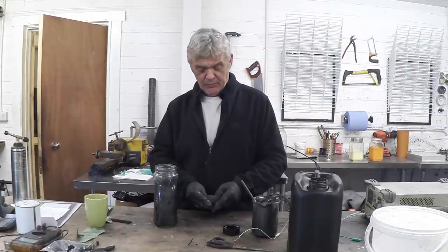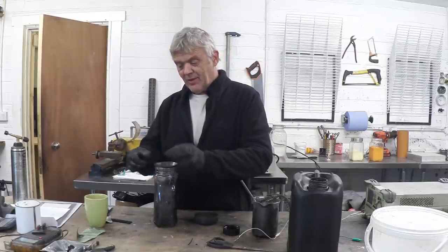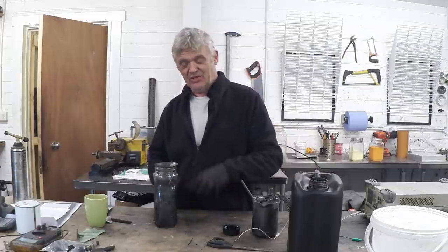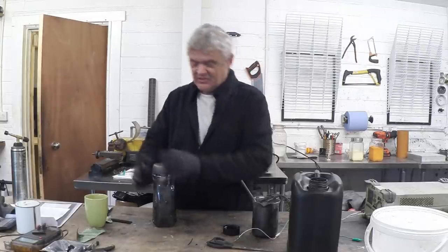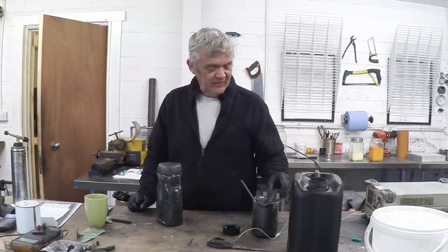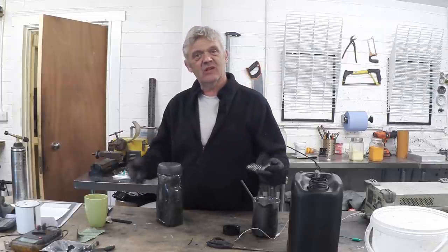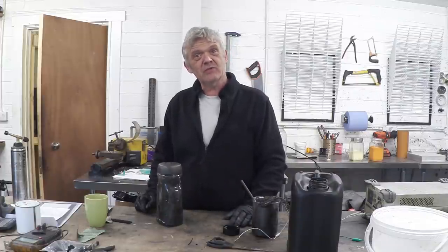Anyway, I was asked to share that — I hope it was of interest and of help. We need to seal it back up obviously, otherwise it will just evaporate away and we'll have a big chunky solid lump of graphitized plastic in there. So I put a bit of a rubber stopper on it, then back on with the lid and it seals up nicely. We give that a bit of time to dry — it'll take about 20 minutes or so to evaporate — then re-dip, evaporate, re-dip until you get the thickness of coating that you want. It's the same procedure whatever material you use — thank you very much for watching.